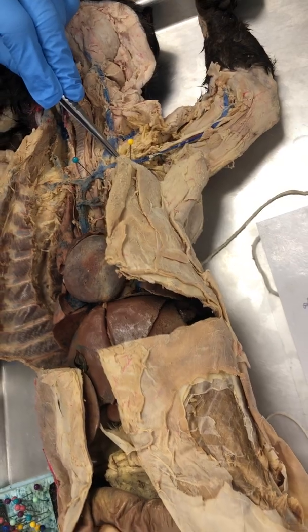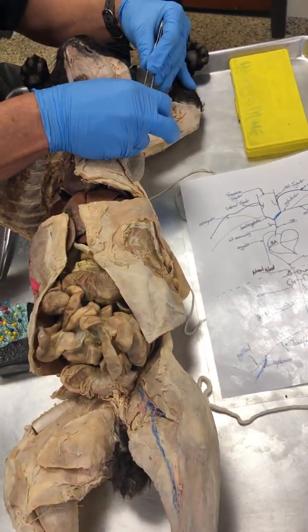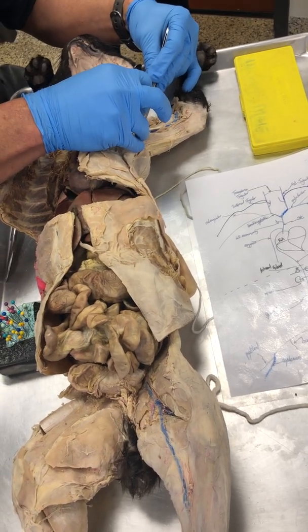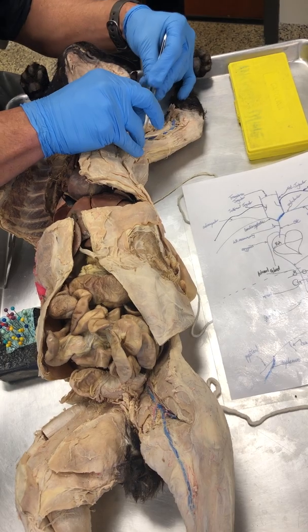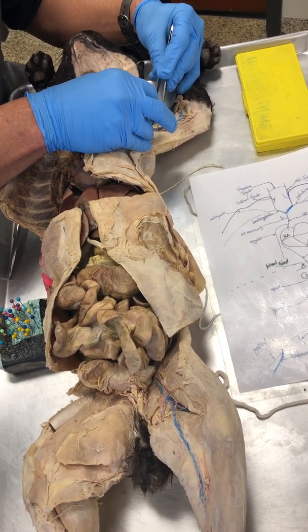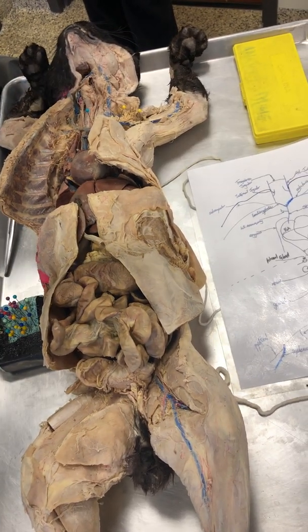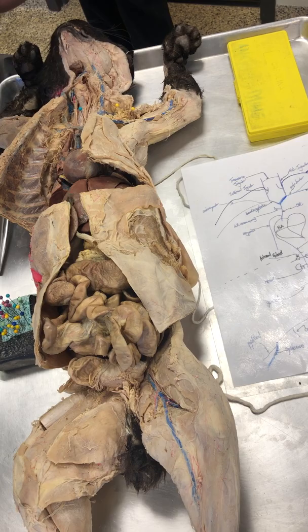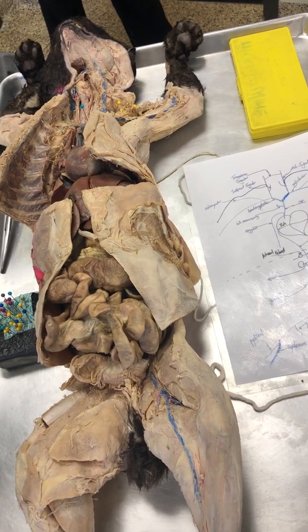So there's that blood vessel right there. That same blood vessel, ladies and gentlemen, leaves the body cavity, and when it gets into the armpit area, what is the armpit area called? Axillary. It's called the axillary vein right there. So same vessel, two different names: subclavian, axillary. Cat is laying like that.